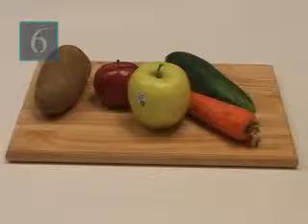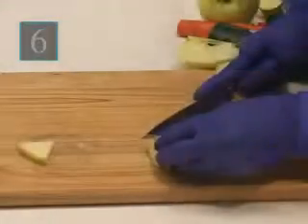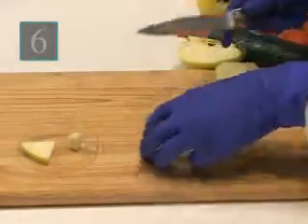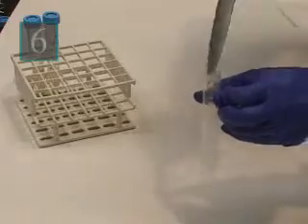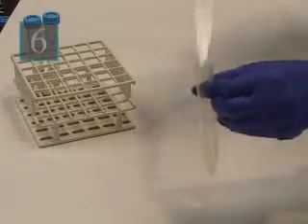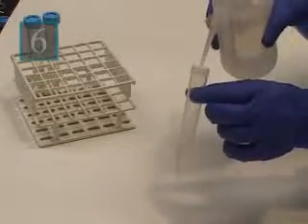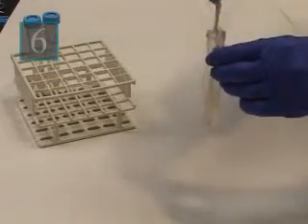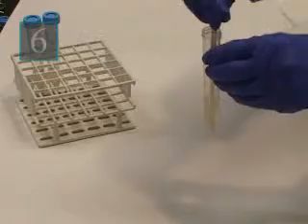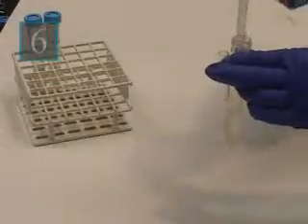To test various fruits and vegetables for the presence of sucrose. A. Place small pieces, about the size of an eraser, of fruit or vegetable in a large test tube. Label the tube. B. Add about 5 milliliters of tap water. C. Use 2 applicator sticks to mash the food for about 2 minutes. D. Let the sample settle for 5 minutes.